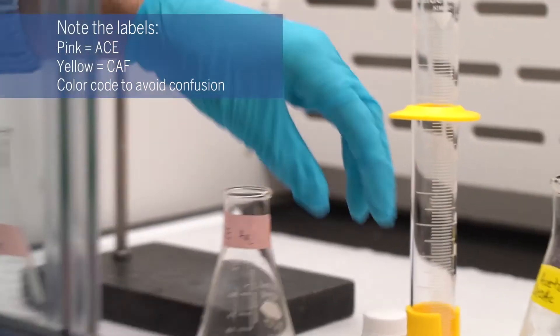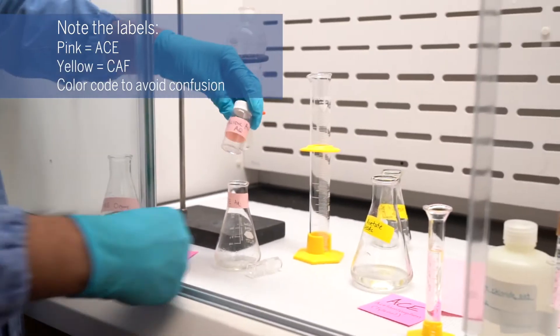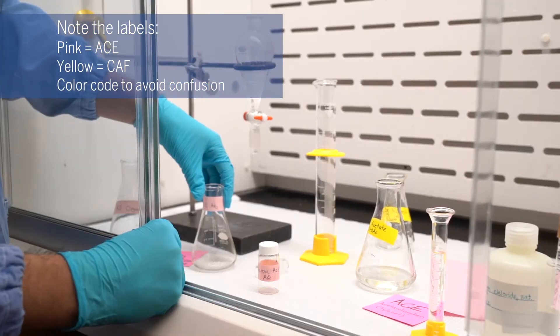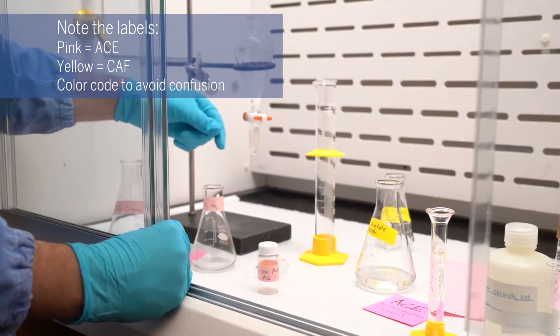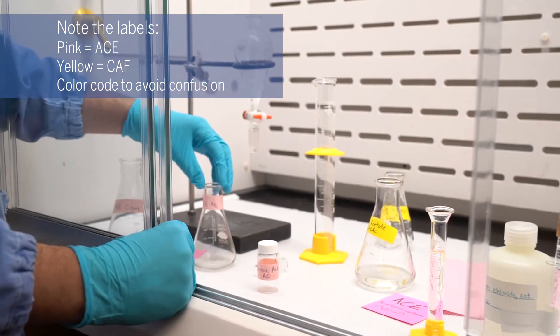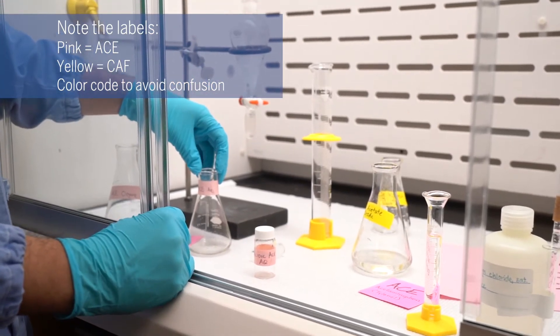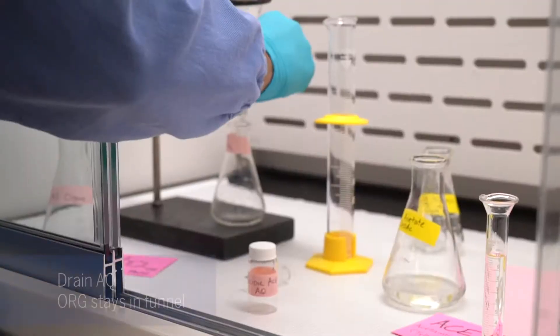Just to reiterate, this is a different liquid-liquid extraction on a different aqueous layer. That's not to be confused with the caffeine extraction with the brine that's sitting in the back.